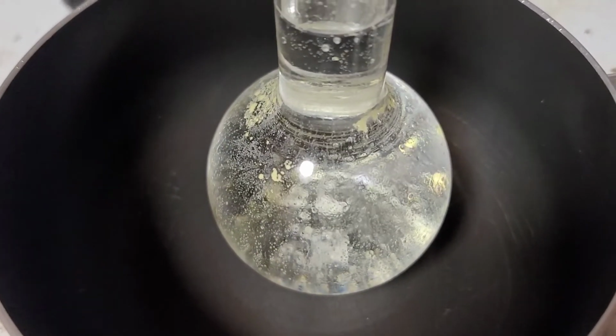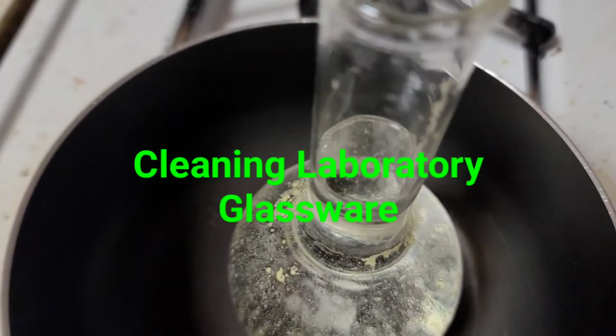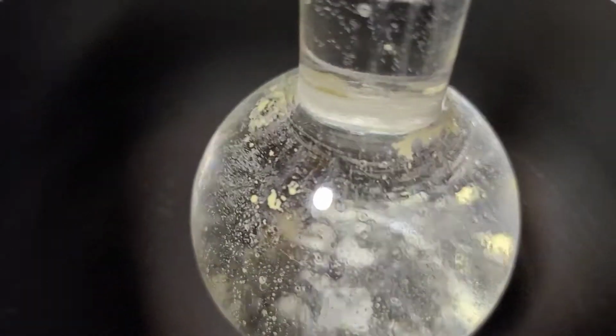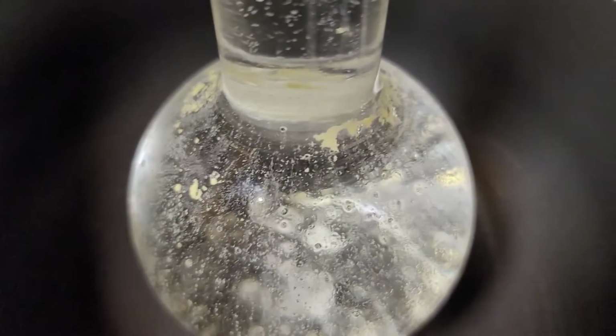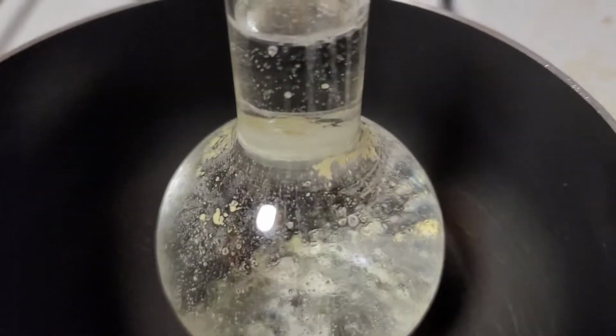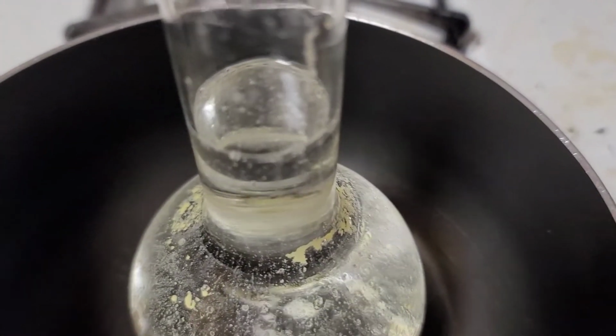How to clean laboratory glassware. Cleaning laboratory glassware. This may not fit every application, but this is a borosilicate round flask with a flat bottom and long neck that I've used for alchemy. And I need to clean it. It proved to be hard to clean.